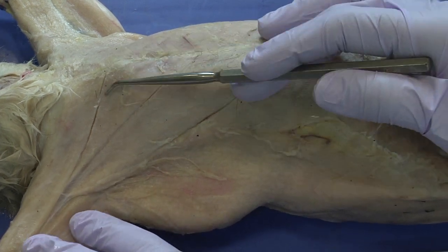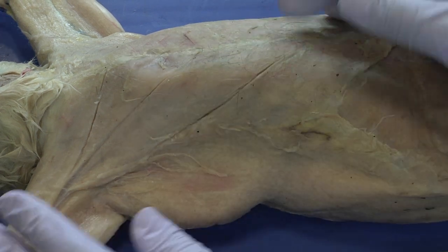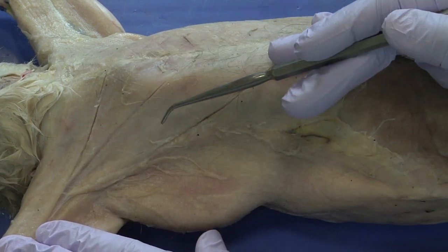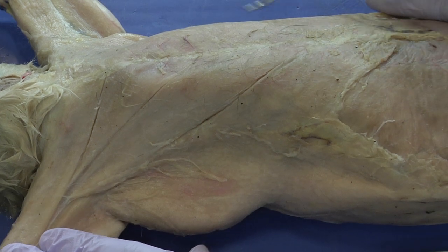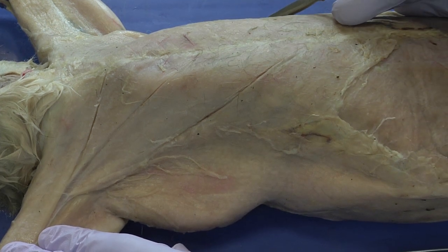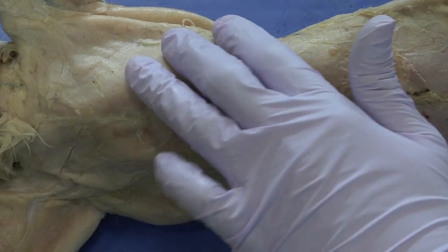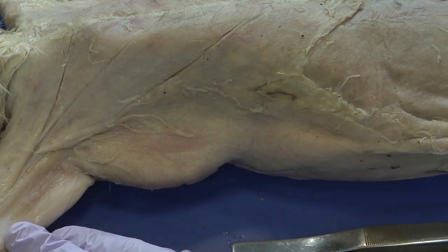You can do this for both sides — the cat's right side as well as the cat's left side. But instead of isolating both superficial muscles on both sides, I'm going to designate one side as the superficial side and the other as the deep side, because there are some deeper chest muscles along the lateral side that we'll need to isolate, which will require cutting into this area. So we aren't going to bother isolating these two muscles on the other side.